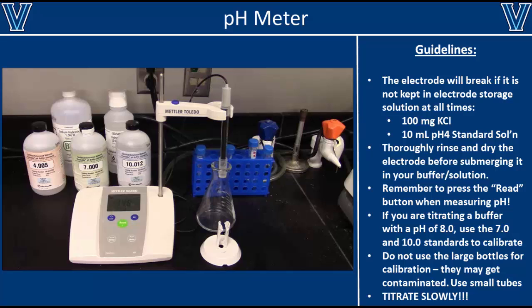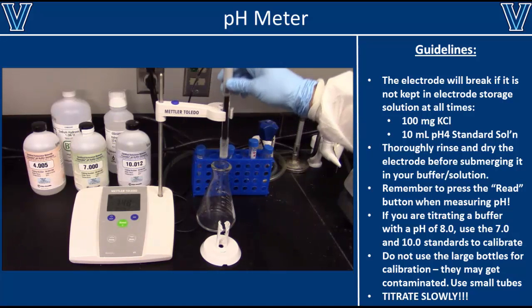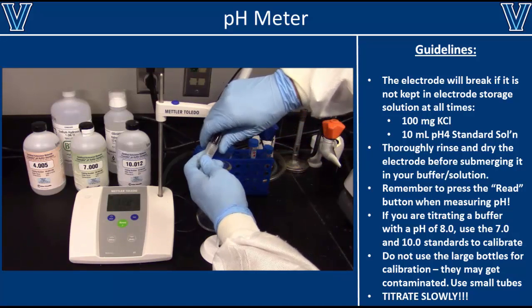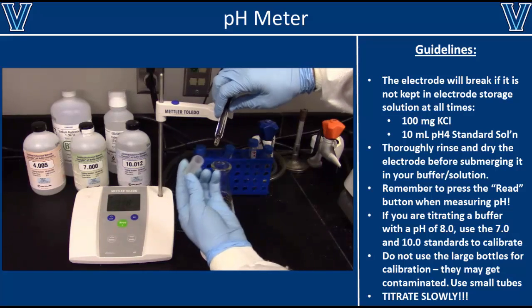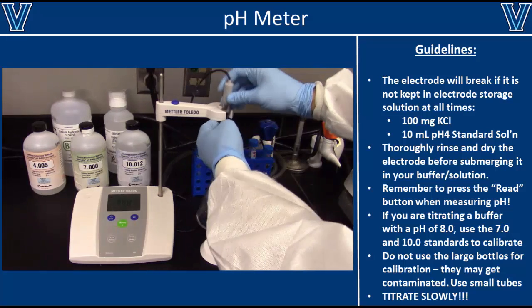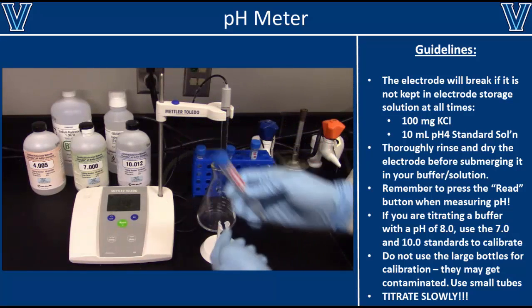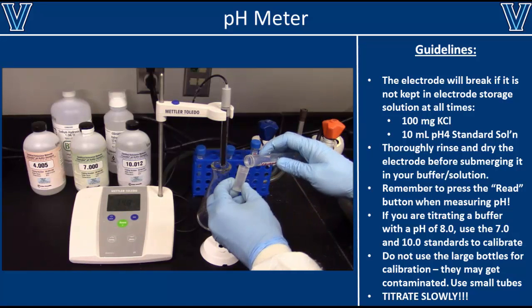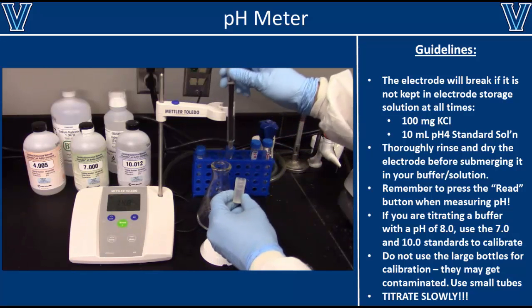The most important thing you need to know about a pH meter is that the electrode must be stored in electrode storage solution in between uses. If the electrode storage solution runs dry, then the pH meter will stop working properly and the electrode may even break. If you ever notice that the storage solution has run dry, immediately fill it back up with fresh electrode storage solution. Several companies offer pre-made storage solutions, or you can make your own by mixing 100 mg of potassium chloride with 10 ml of the pH 4 standard solution.